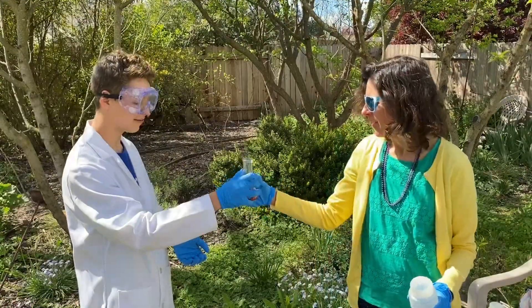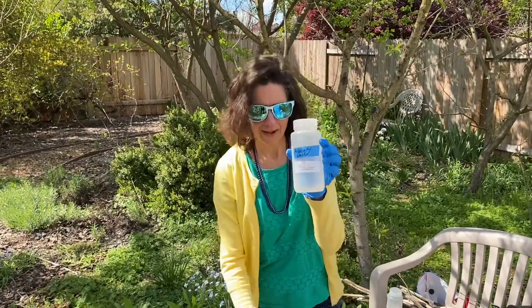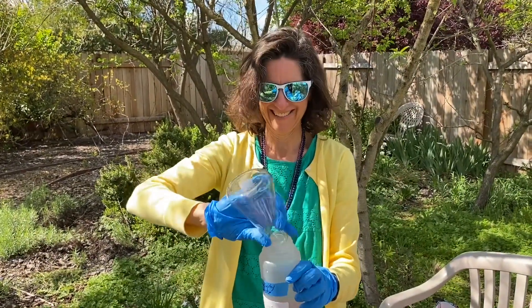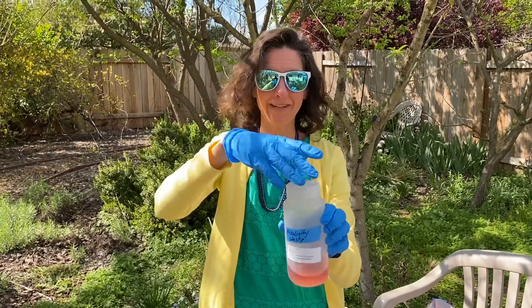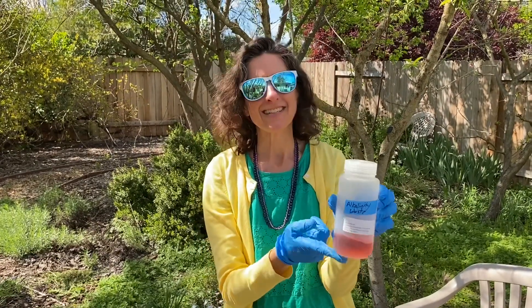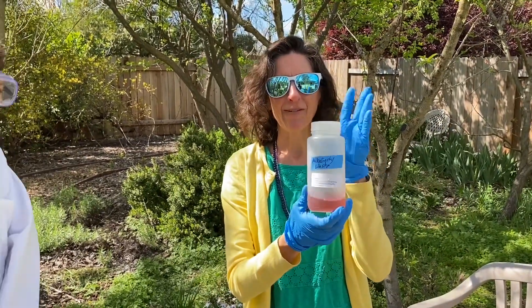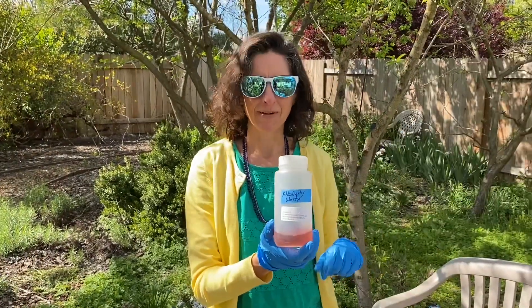What do we do with this? Oh, very good question — we don't want to just throw it on the ground. We're going to put it in the alkalinity waste bottle. Can we drink it? No, we cannot drink it. It's very acidic — it's about a pH of 4.7 at this point when it turns pink, or 4.5. We've got it in the waste bottle. We'll take it back to the lab and send it over to the hazardous waste people at Sac State.